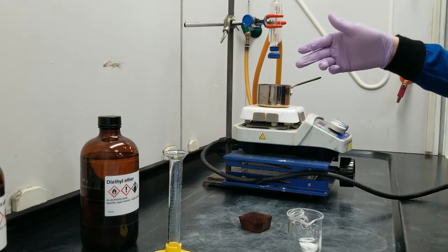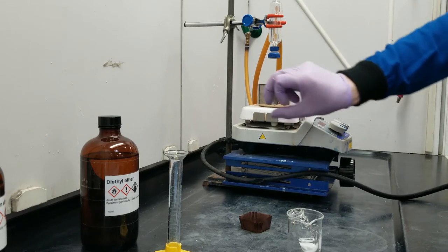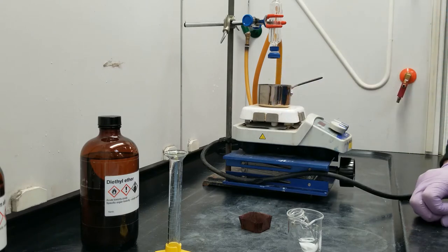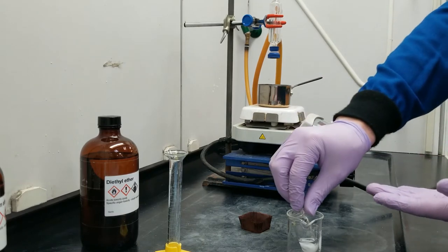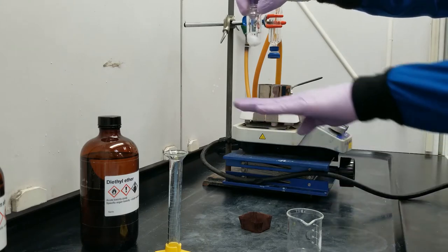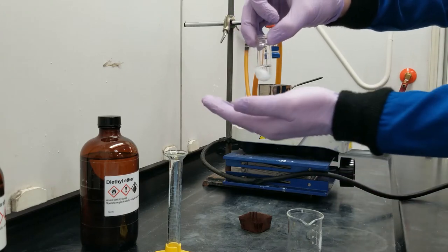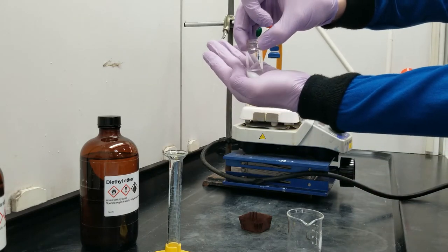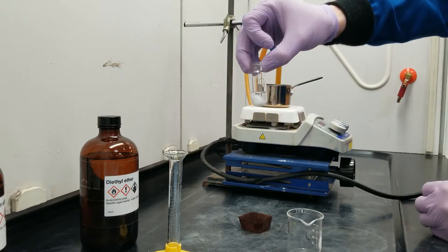Here's my setup in which I'm going to do the reaction. I've got a really cute little sauce pot here with just about a centimeter of sand at the bottom, as well as a reflux condenser. Now, the reason that we use sand is because I have a round bottom flask here, and if I set this on the flat steel sauce pan, it's just going to contact at the very bottom spot here. But if we put this in a sand bath, it'll actually sink in a little bit better, and the heat will transfer more effectively all throughout the round bit of the bottom of this flask.